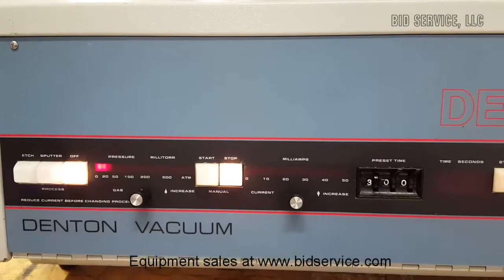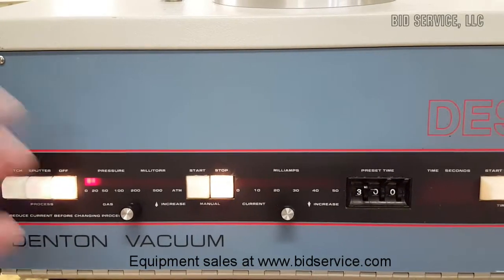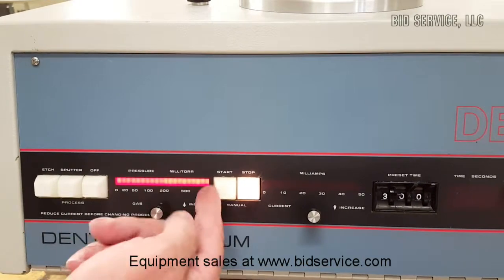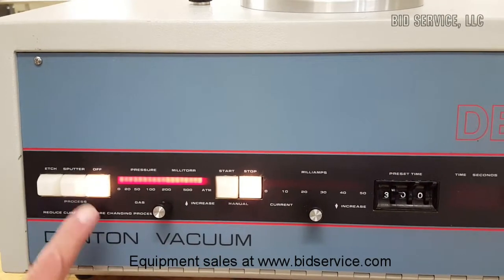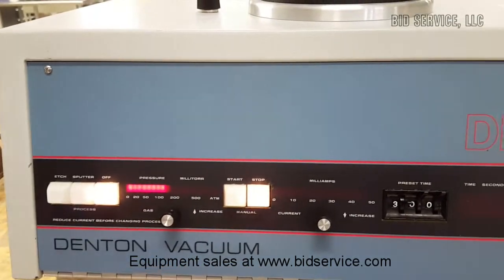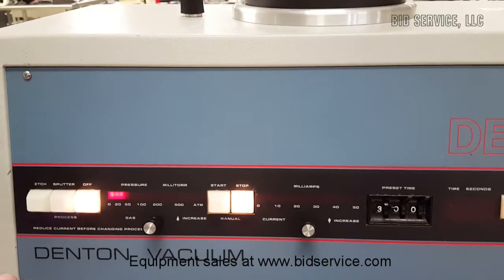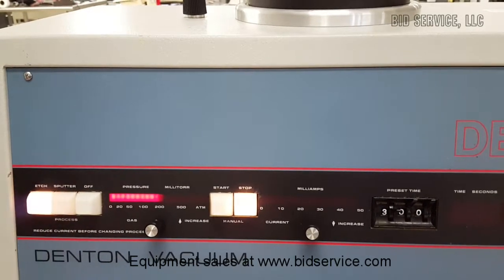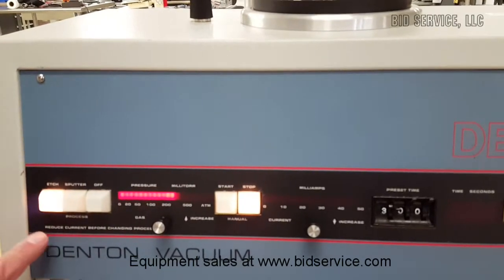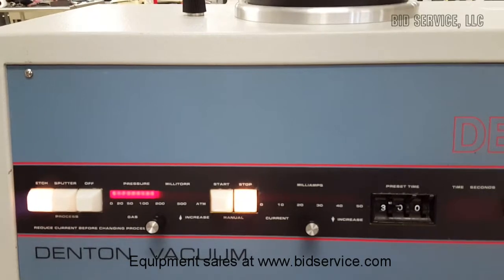Once it comes down again, which is much quicker this time, we'll do it again until it's able to stay lit. As you can see, it went off scale, but it's pumping back down much faster. If the etch goes up again, it will come back down, and now you can see that since it did not go full scale, the etch has stayed lit.